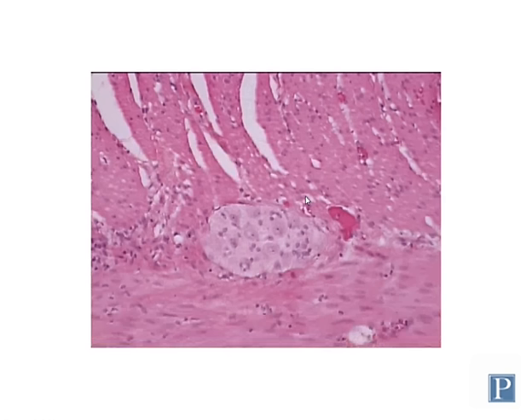And we're going to look at a final type of ganglion, which is a parasympathetic ganglion. Now, sympathetic paravertebral ganglia are located adjacent to the spinal cord, very close to the spinal cord. Parasympathetic ganglia are far away from the spinal cord and either very close to or directly embedded within the walls of the tissues that those neurons innervate.